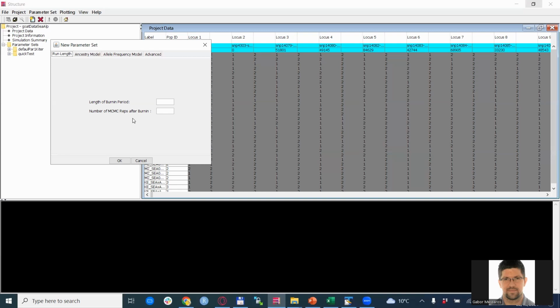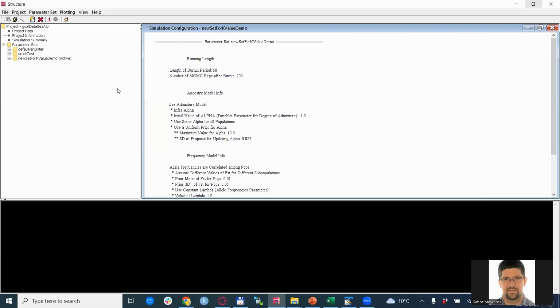I don't have it in mind right now, but I know that these are definitely in the high thousands. For now, we will set, let's say, 50 burn-in and, I don't know, 200 for the MCMC reps. So this is way too low. This is really just for the demonstration. We click OK, and we name this parameter set "New set for K value demo." Okay, so we have our parameter set that is also active, and we can now proceed with the actual analysis.